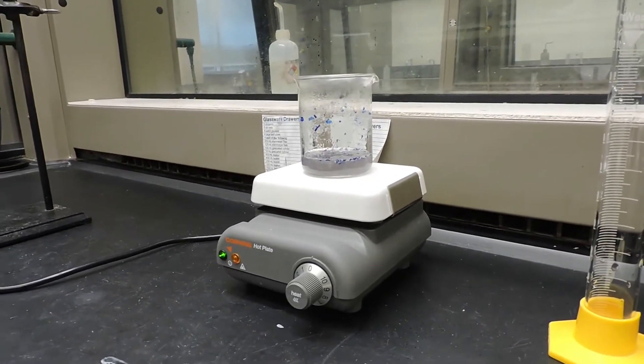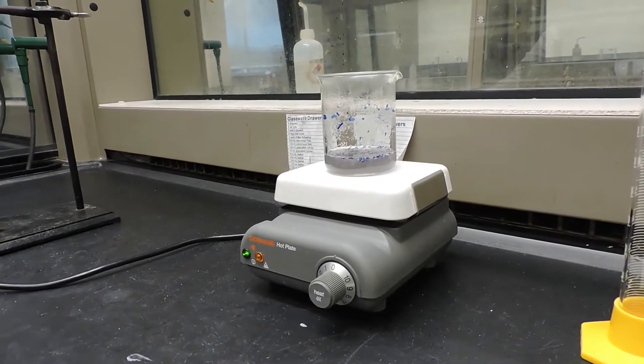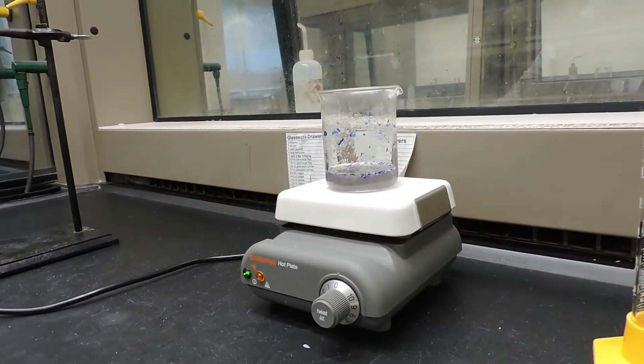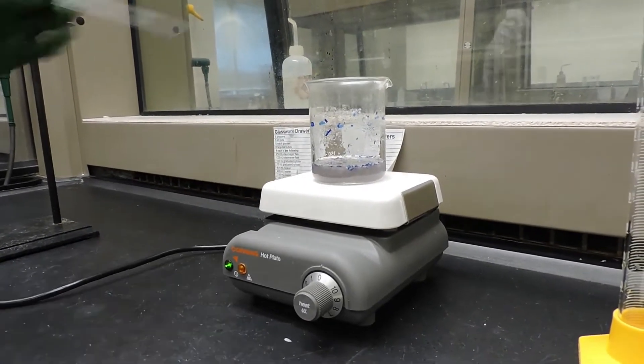Now we're just heating a little bit to try and dissolve some of the aluminum hydroxide that has formed and try to get our solution as clear as possible.